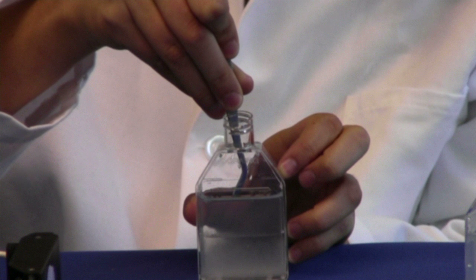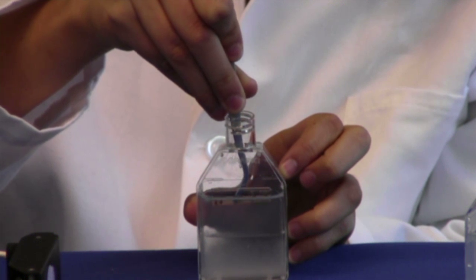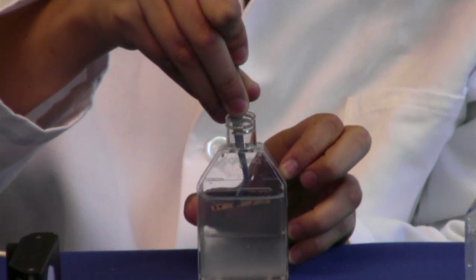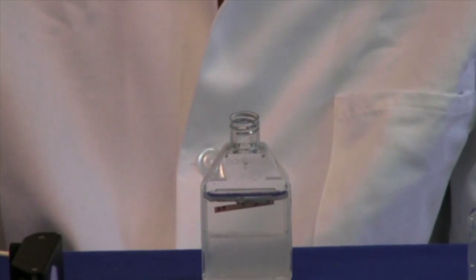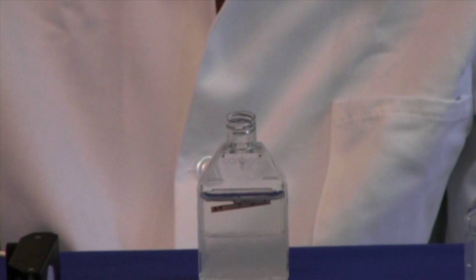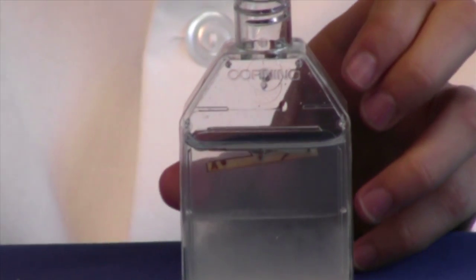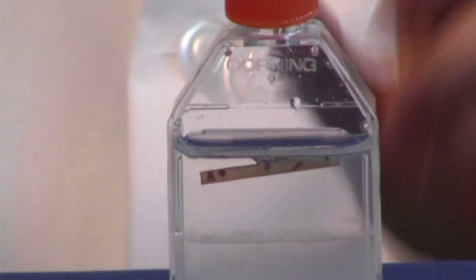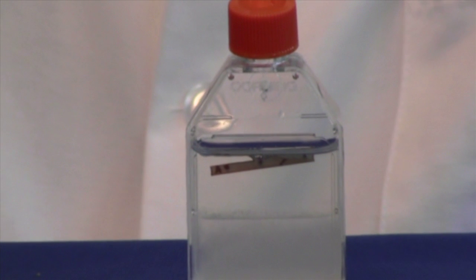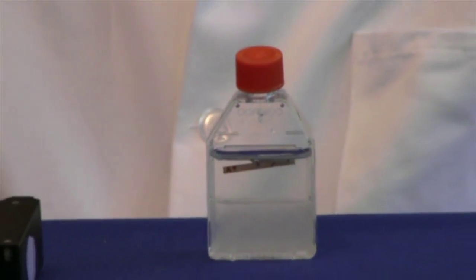Once inside, the seed stick can be gently pushed down into the gel-like substance to submerge the seed sticks into gel. With the planting complete, the cap will be placed back on and the seeds can begin growing with their nutrients and air exchange occurring.